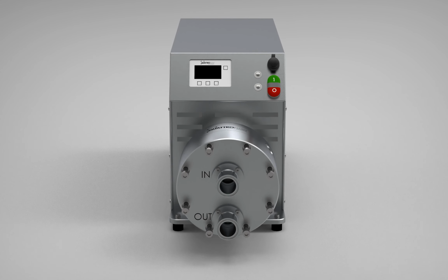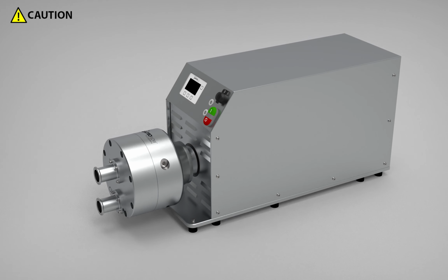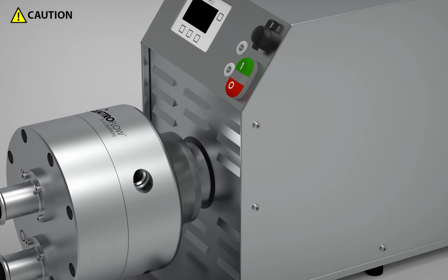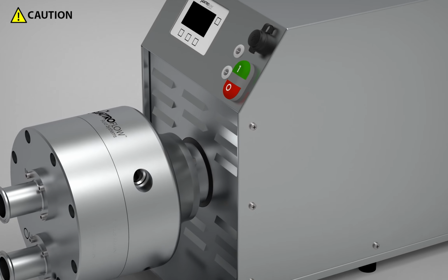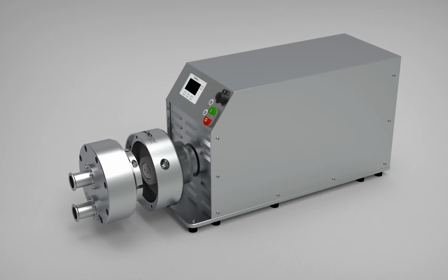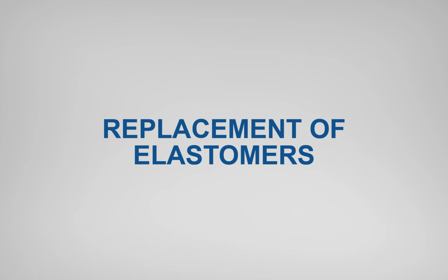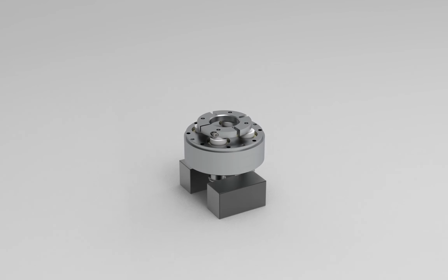Remove the screws. Hold the pump chamber while removing the screws for safety precaution. Remove the locking screw. Loosen the clamping ring screw. Remove the pump chamber. Place the pump chamber horizontally, so that there is no load on the connector ports.